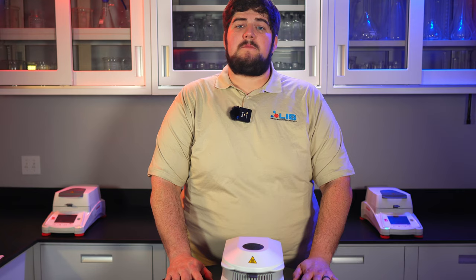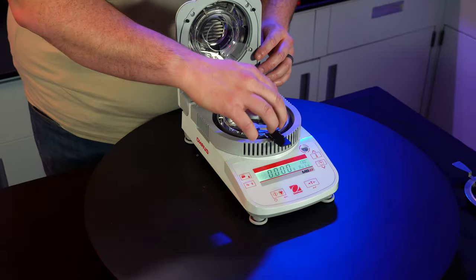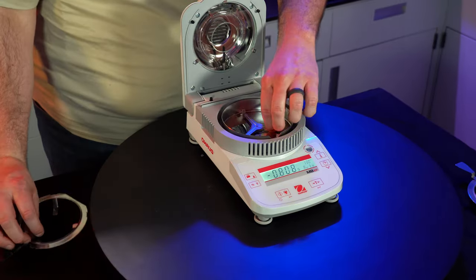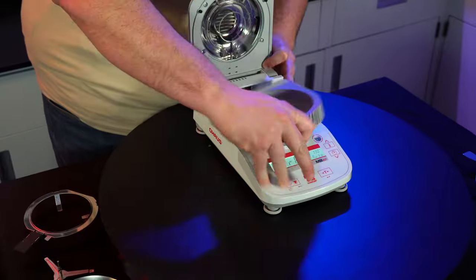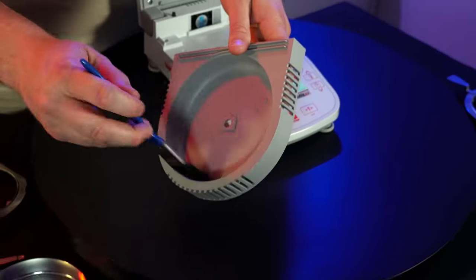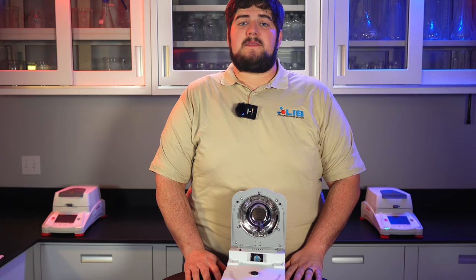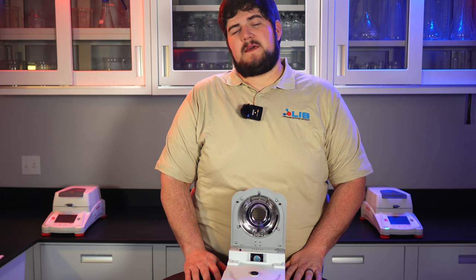To achieve the best performance while performing tests, it's best to clean the instrument between each test. Remove and dispose of the sample. Remove the pan holder. Remove the air shield. You can also remove the chamber from the body. And with a clean wipe or a brush, clean out the remaining debris. Now just reassemble all the pieces back together and apply a new sample dish and you're ready to start the next test.